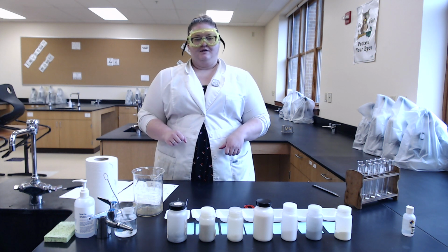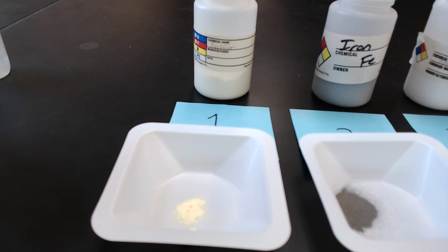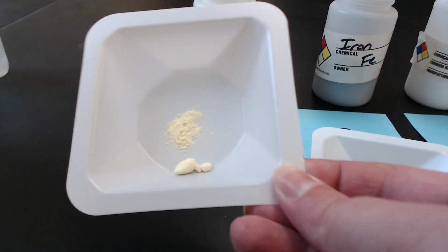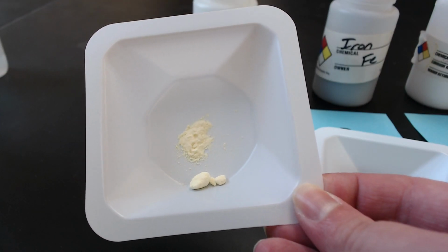Okay? Let's get it. Okay, so I have zoomed in on our samples. I know in the procedure it says to use test tubes, but the camera wouldn't exactly focus on that, so I've instead put them into weigh boats so that you can record their physical state, solid, liquid, or gas, and their color. Right? So our first chemical is sulfur. So take a look.